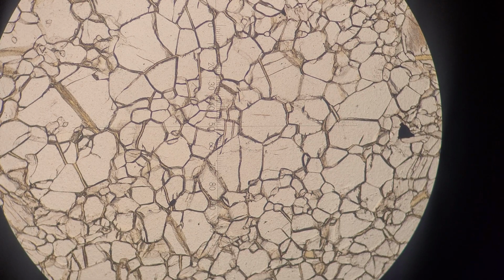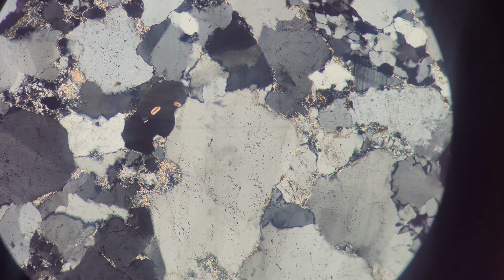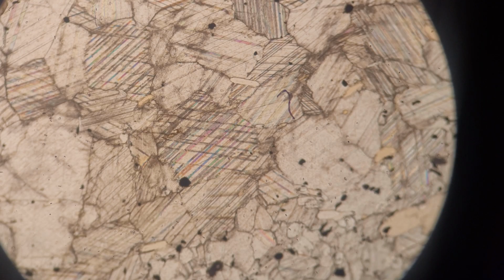Opaque minerals, such as oxides or sulfides, like pyrite, don't transmit any light at this thickness, and always appear black, which means we can't find their properties with transmitted light, and need to study with reflected light instead. We won't be focusing on these in this video. Non-opaque minerals do transmit light, so we are able to find their properties. Non-opaque minerals include silicates, such as quartz, and carbonates, such as calcite.